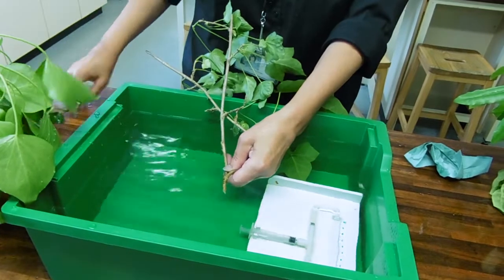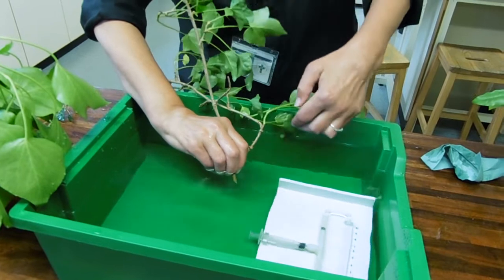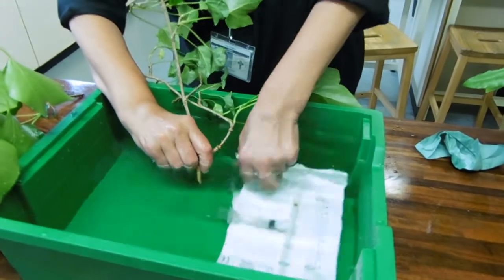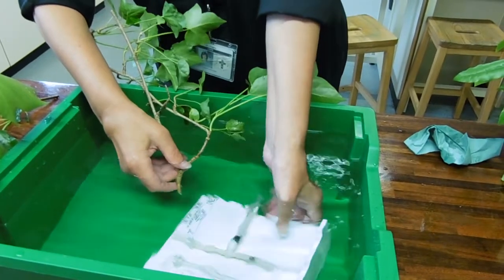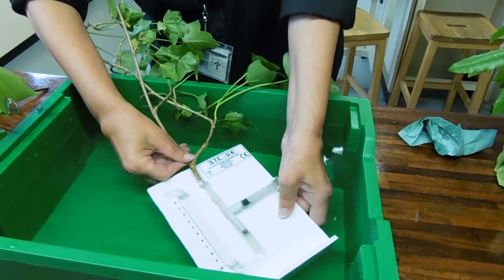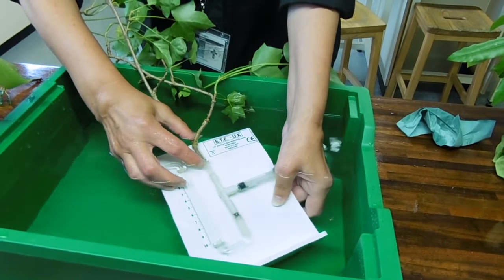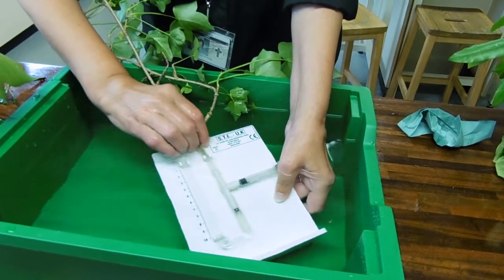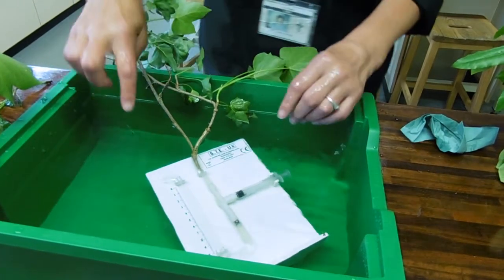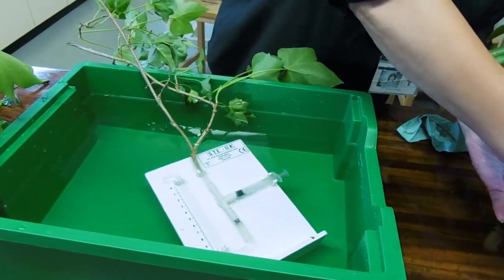You want to try and keep the leaves as dry as possible while you're doing this bit, because if they're wet they're building up a layer of humidity, so you might need to dry them afterwards. You're going to insert the plant's stem into the top of your equipment, so that you've got one continuous unbroken column of water.